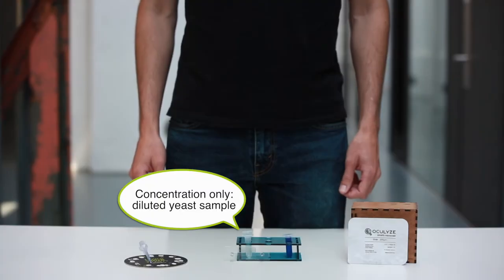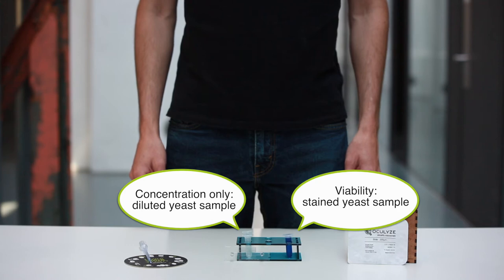Now, let's load the chamber. If you're only measuring concentration, use the diluted yeast sample. If you're measuring concentration and viability, use the stain sample.